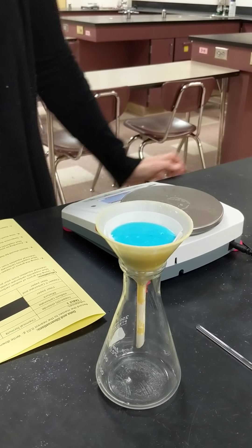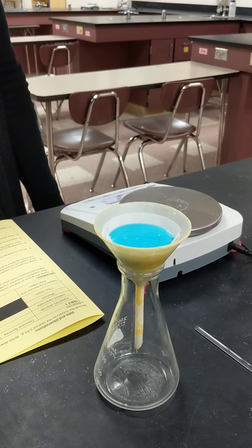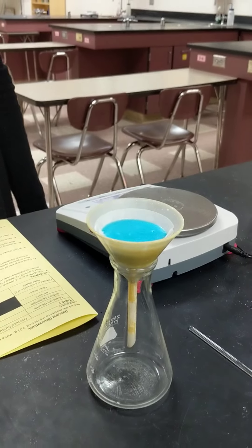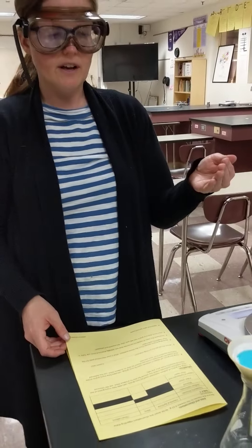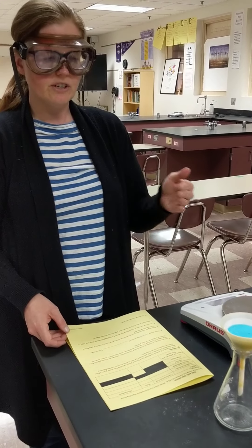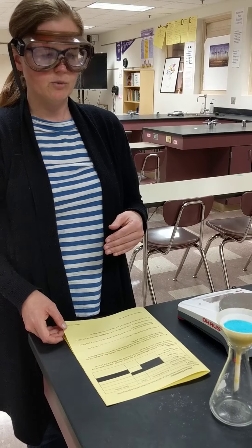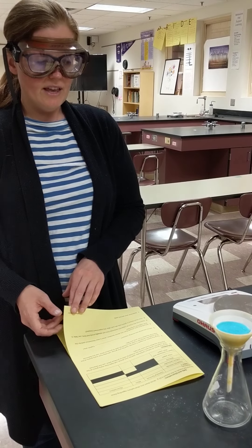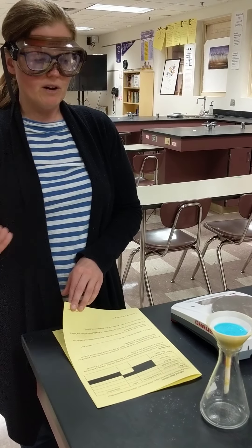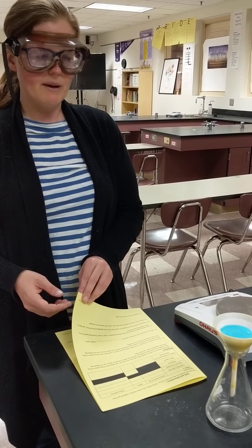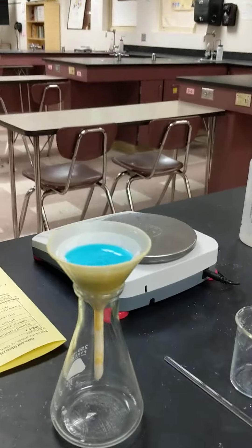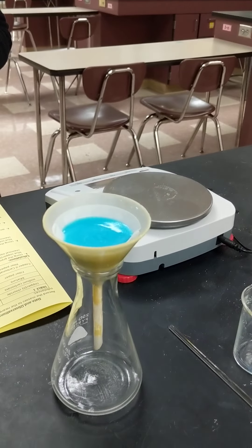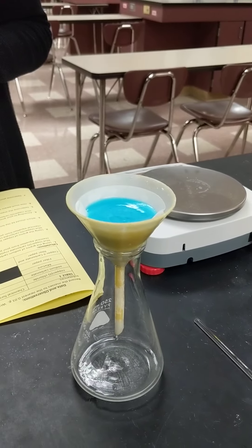And so now we just sit and wait. So we're going to turn the camera off here. What you can be doing right now is your, whatever item your teacher wanted you to work on. I'm sure he or she has assigned you something to work on. That's what you're going to work on right now. And then you can watch the second video to see what happens after we're done filtering. But as you can see, drop by drop, we're getting more and more of that clear solution down there.